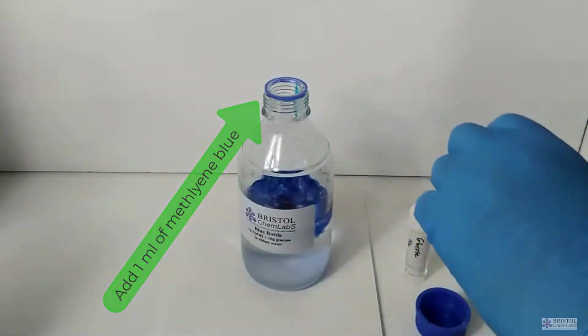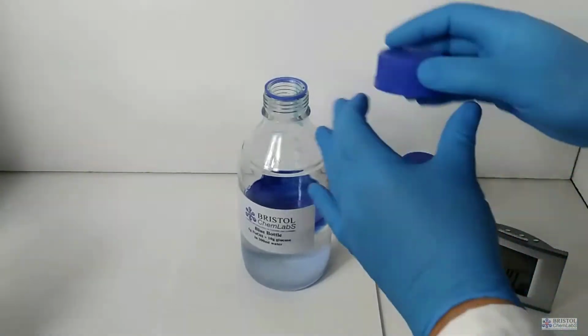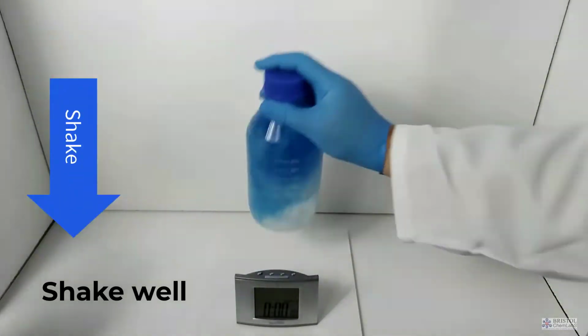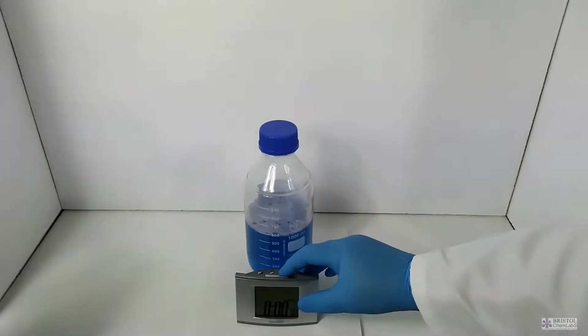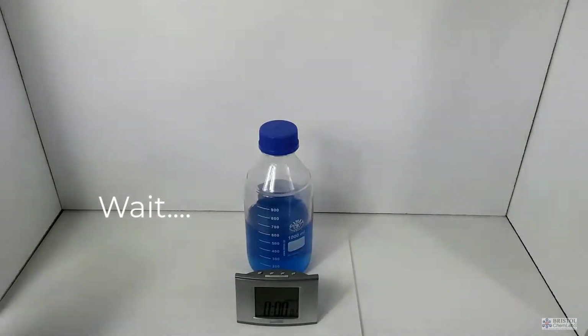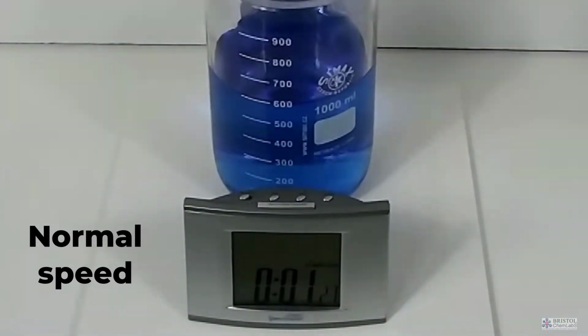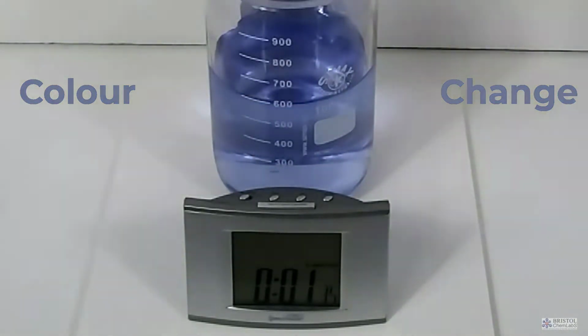When we put the lid on and shake up the solution, the oxygen has a chance to go into the methylene blue and cause it to turn to its oxidized form. And we can see from the equation later on as to why this is oxidation. After a few minutes, the methylene blue solution becomes the reduced form as the oxygen leaves the solution. You can of course then shake it up and show that this is a reversible change.